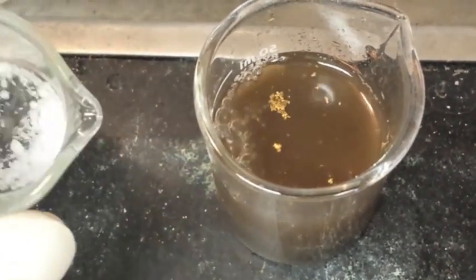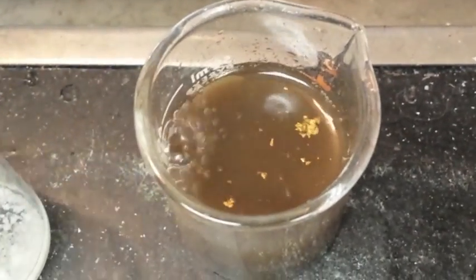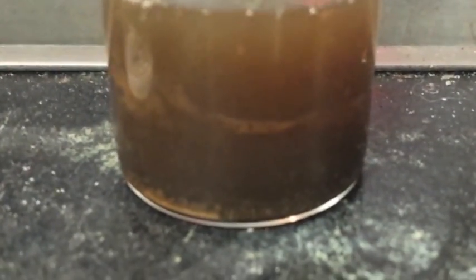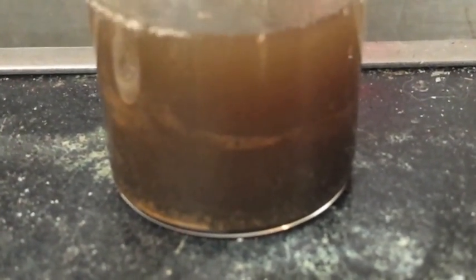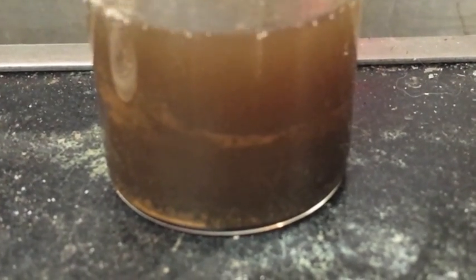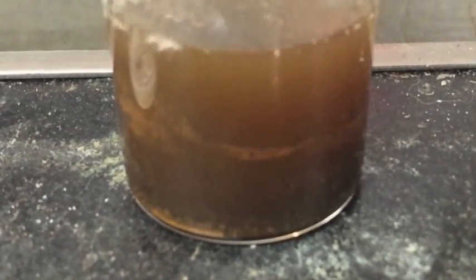I'm going to have to dissolve the rest of this and add a little bit more distilled water. And when we're done, this is what we're going to have. And we'll let it set for about an hour to drop all the solution out. And I'll pick back up from there.